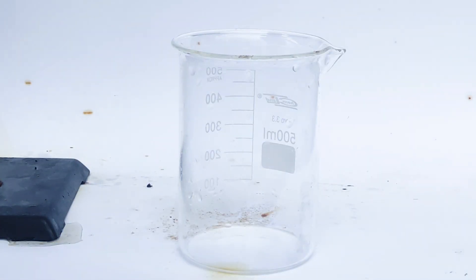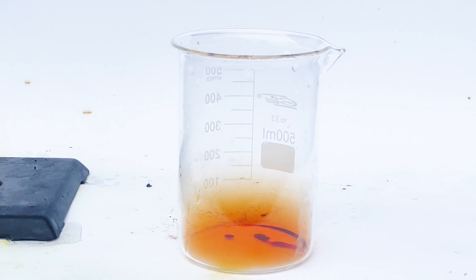So for the first experiment we're gonna need some sodium and bromine. First I've added some drops of bromine into a beaker. As you can see a few seconds later the beaker is already full of bromine vapor.